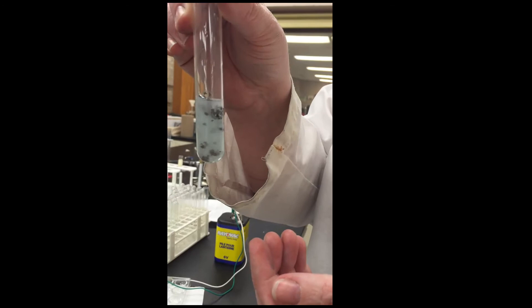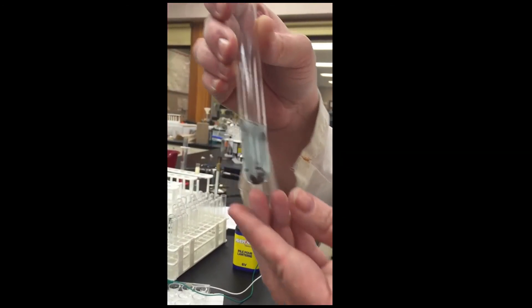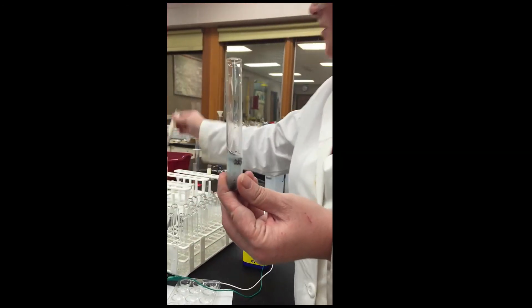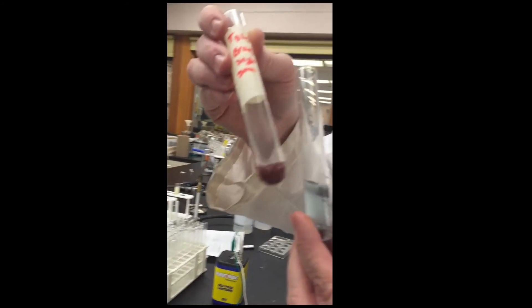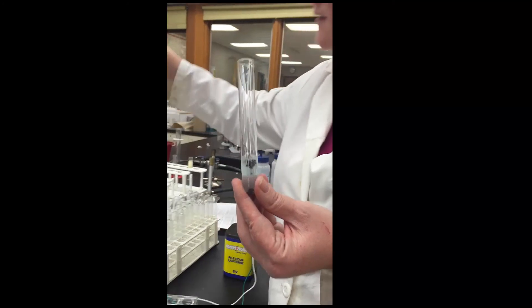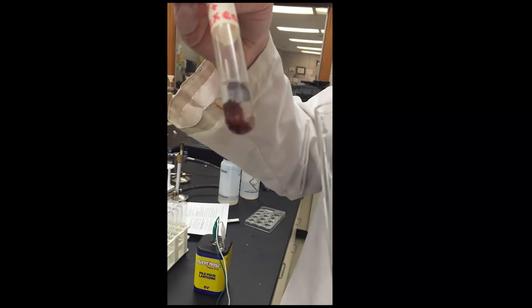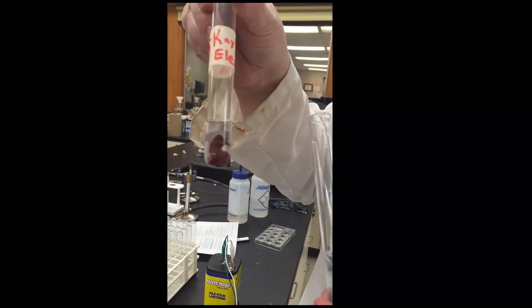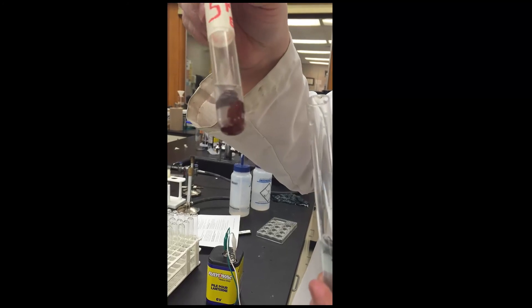It has a warm sensation. Eventually, this is a different one, you end up with copper at the bottom. I think that this is a better one, showing the copper at the bottom, and there's a chunk of something in there. It must be aluminum foil that did not react.